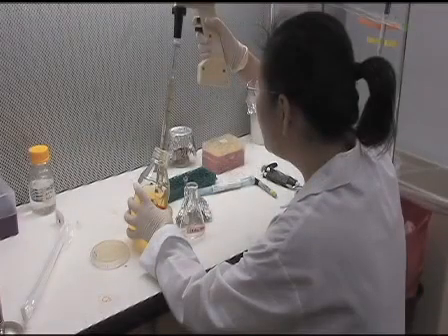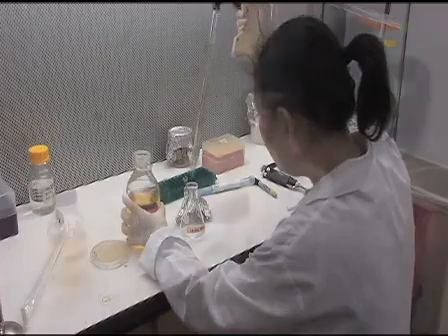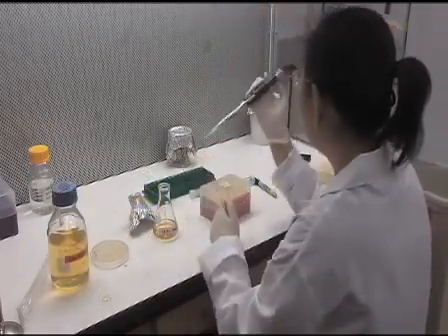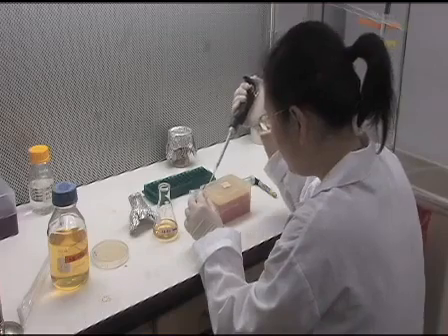For composite plant transformation, we normally use the Agrobacterium rhizogenes K599 strain. The shuttle vector, or binary vector, can be transformed into the K599 following the standard Agrobacterium tumefaciens transformation protocol.